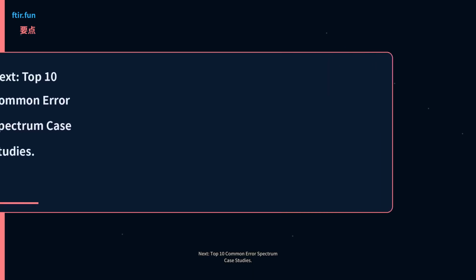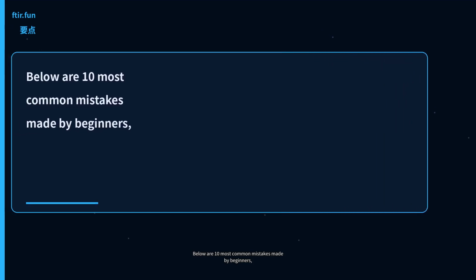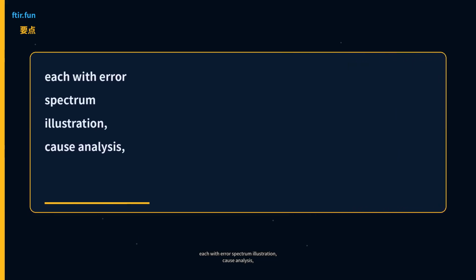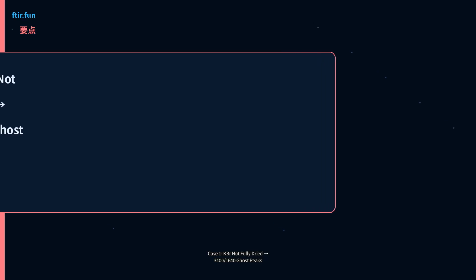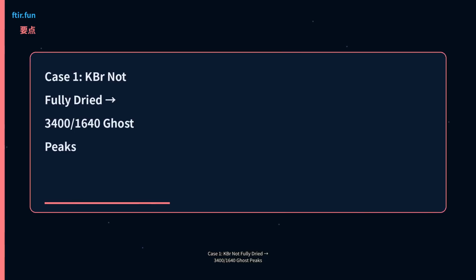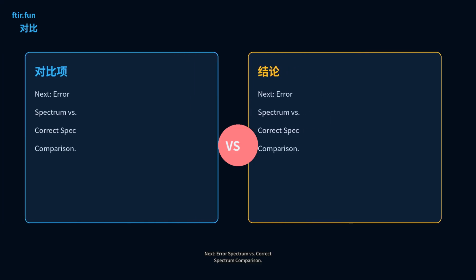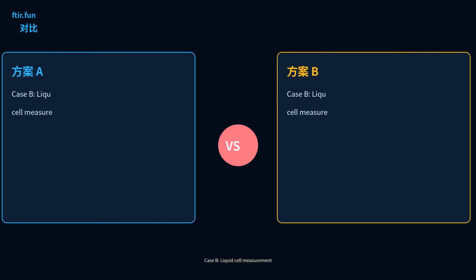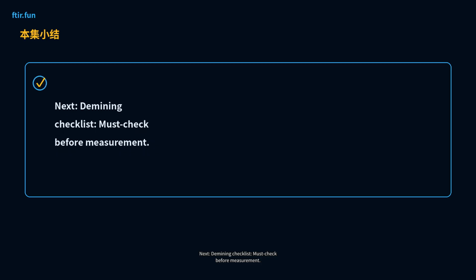Next, top 10 common error spectrum case studies. Below are the 10 most common mistakes made by beginners, each with an error spectrum illustration, analysis, and remedy. Case 1: KBr not fully dried, 3,400 and 1,640 ghost peaks. Next, error spectrum versus correct spectrum comparison. Case B, liquid cell measurement. Next, the checklist to check before measurement.